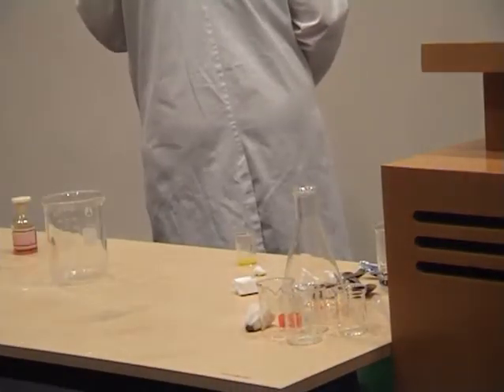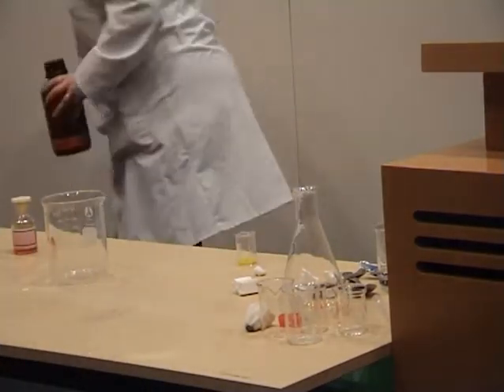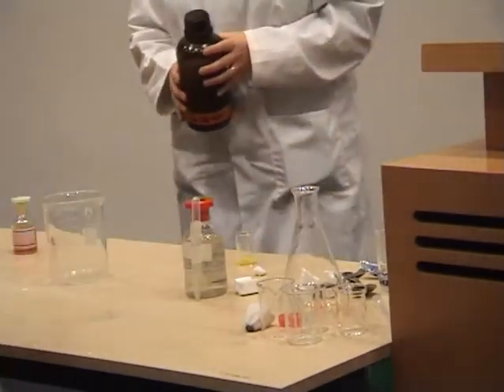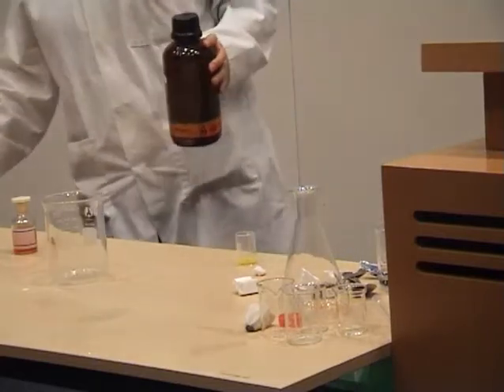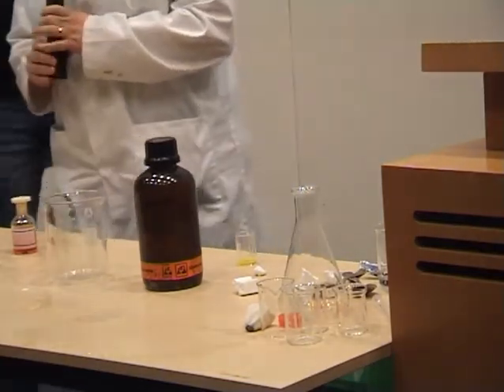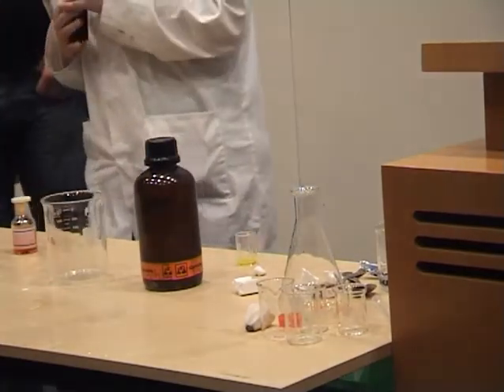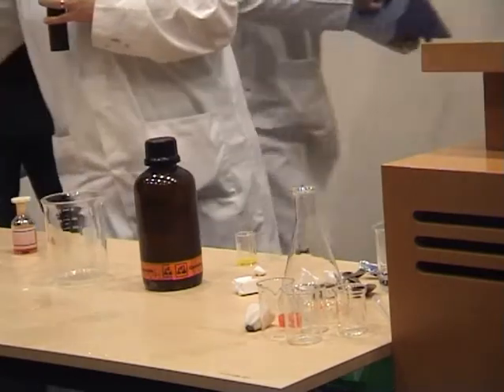Acids and bases are not that boring. So, I'll do a quick demonstration for you now on a few acids and bases, how they react with each other, and what the results are. So, what have you got first, Mandy? As you know, mostly acids and bases are clear liquids. You can't really tell them apart by just looking at them. So we're going to show you how an indicator can work to help you see the difference.